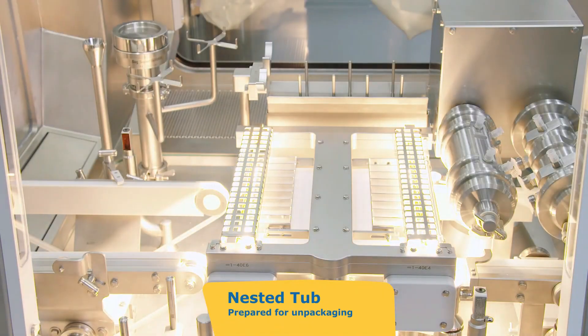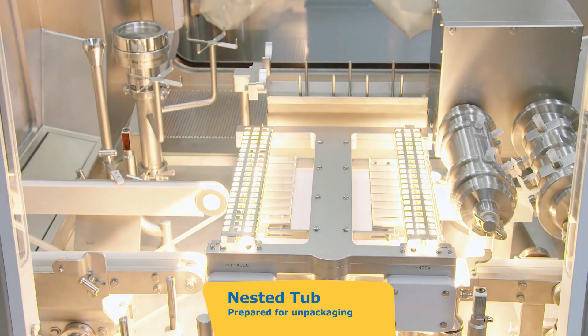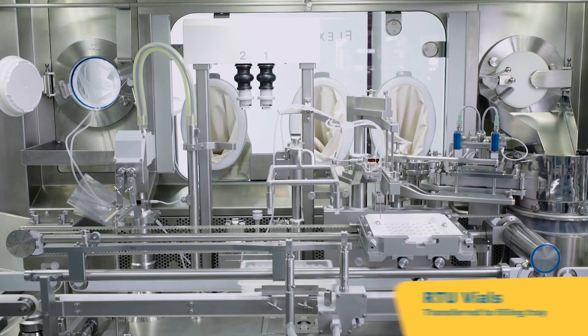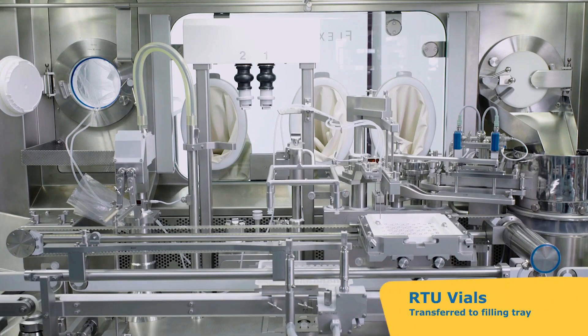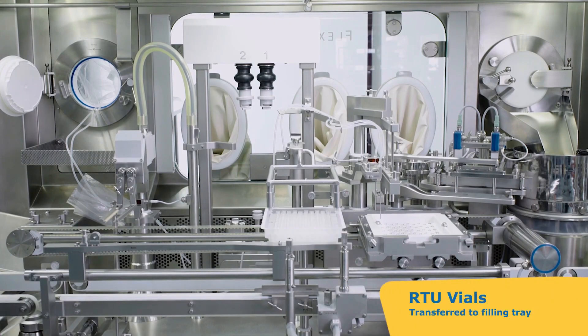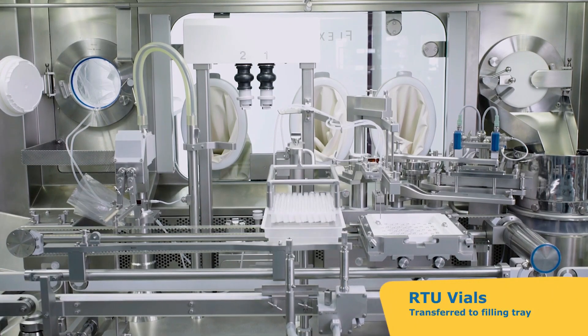Risk of contamination: Isolators carry a lower risk of contamination, as they are completely closed systems with minimal human intervention, ensuring higher sterility assurance.